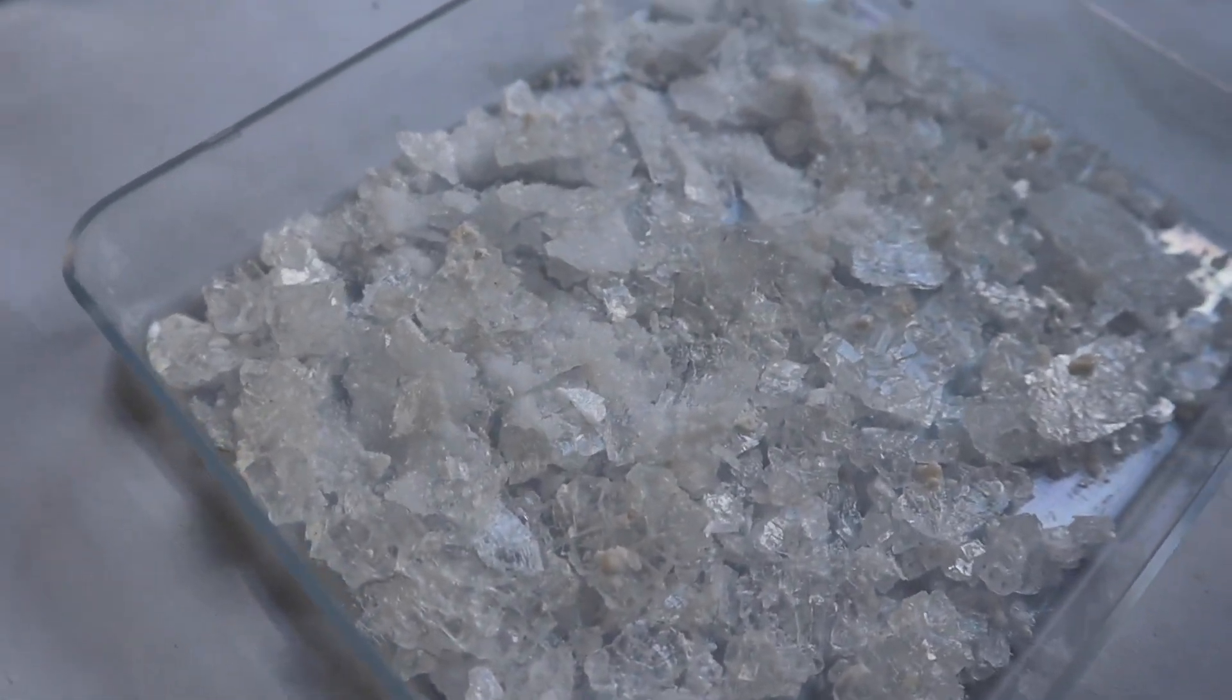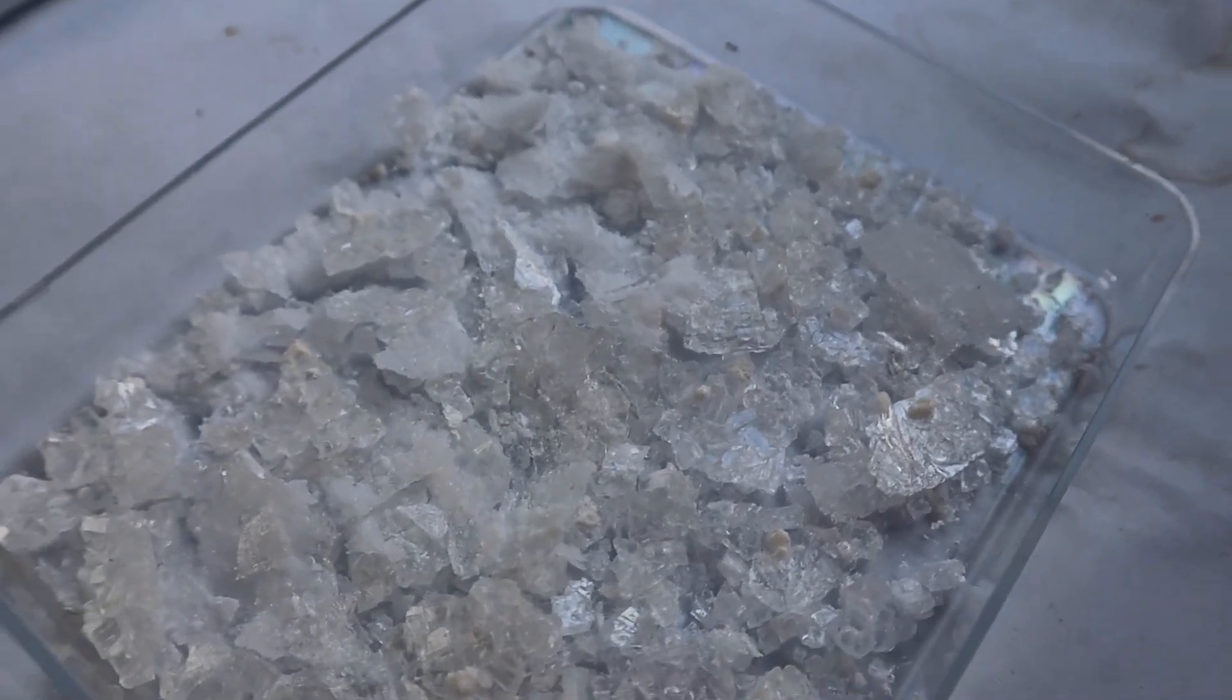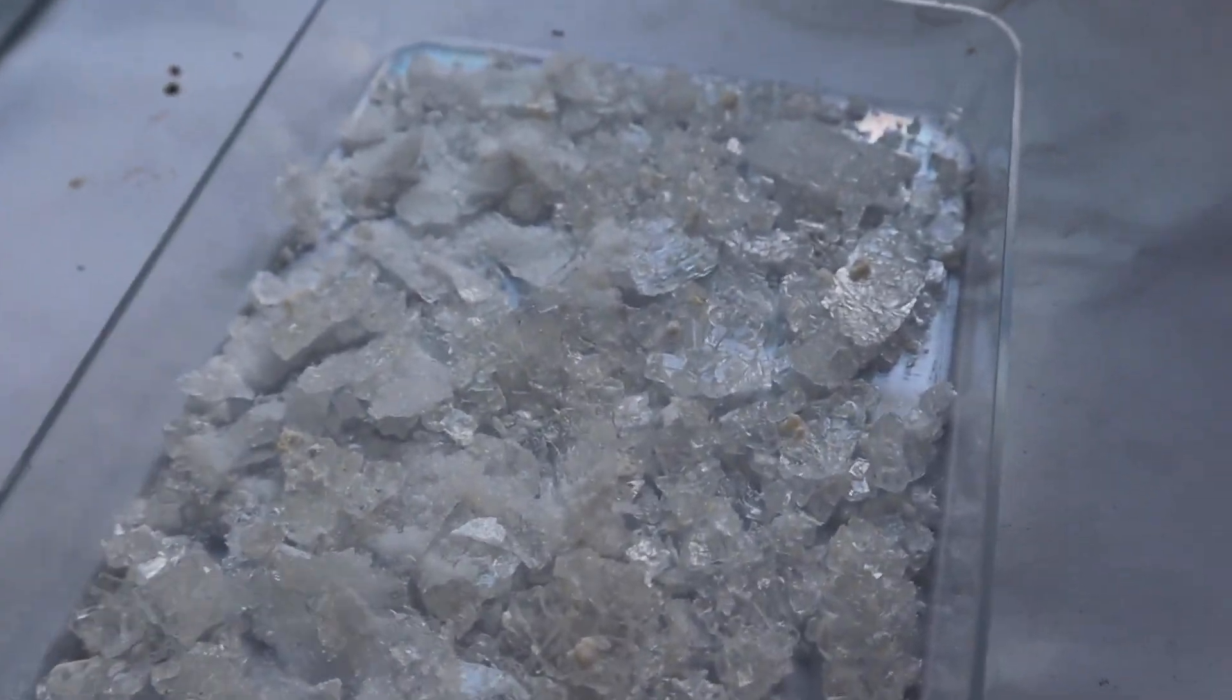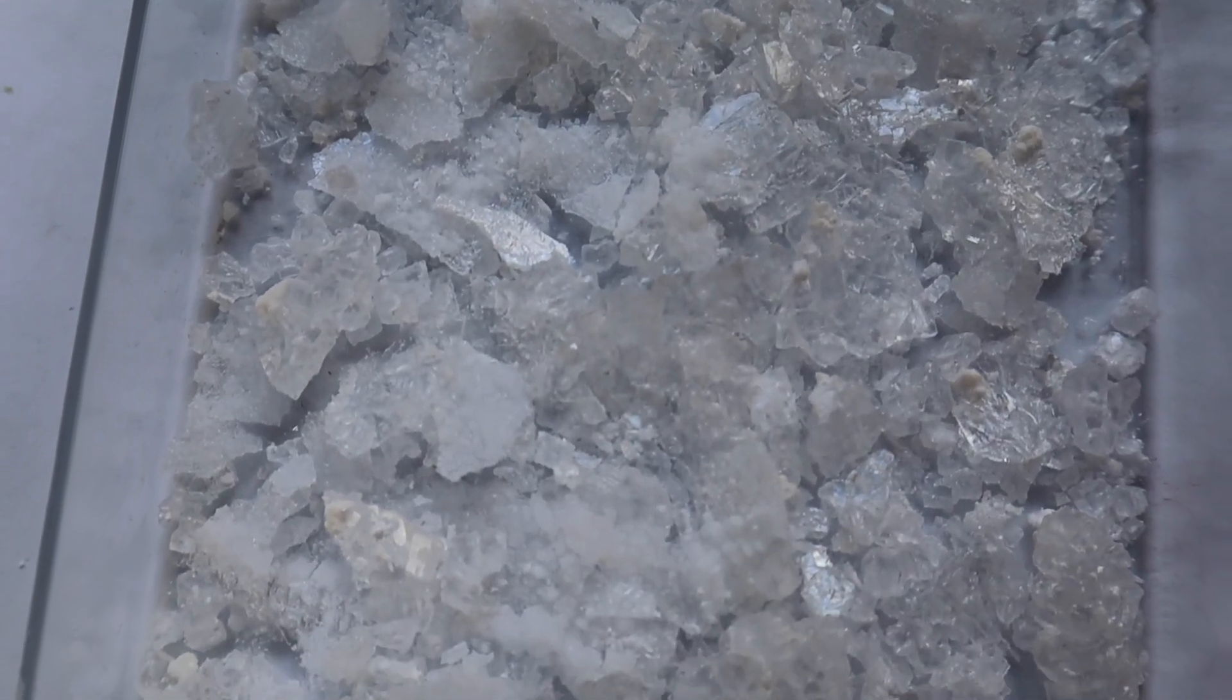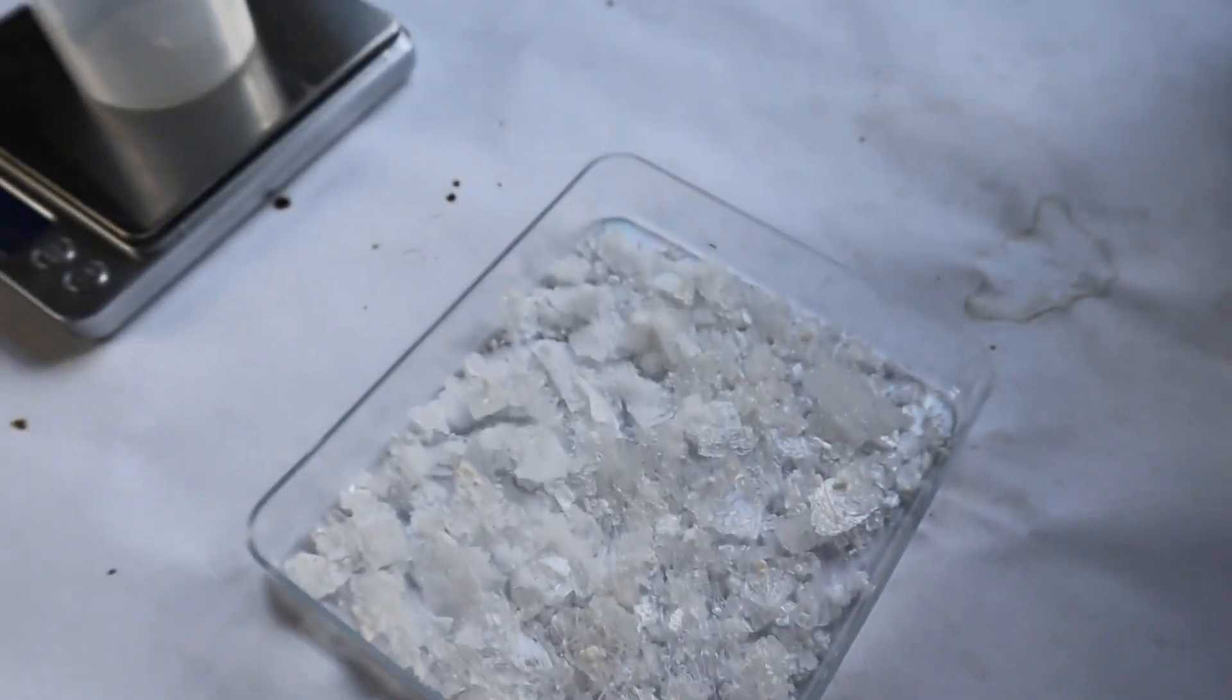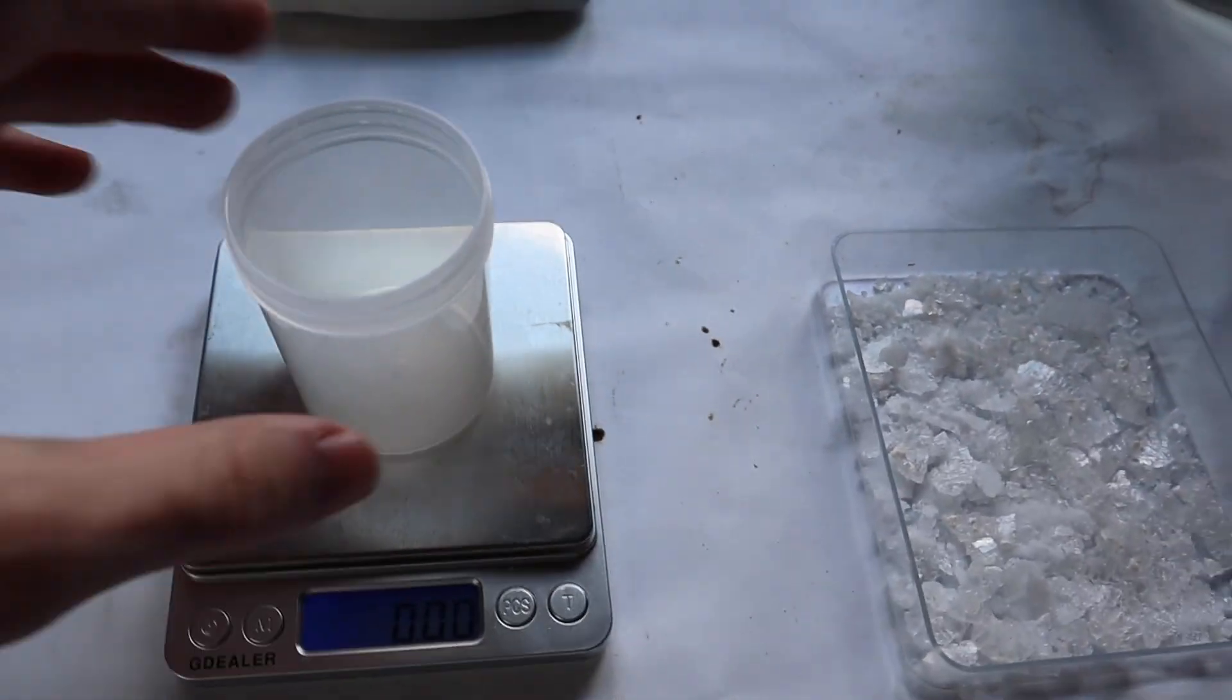This is the final product. It took much longer than 48 hours to actually completely dry. It looks like it came out looking pretty well. So what I'm going to do is weigh it now and transfer it to this little container.